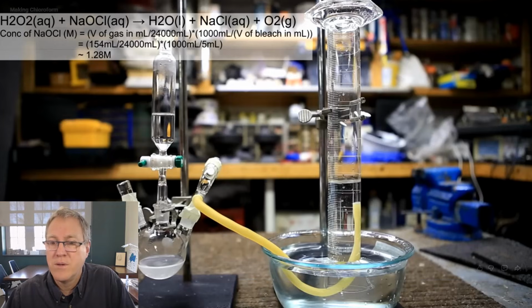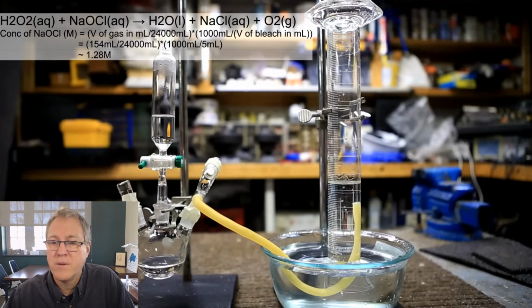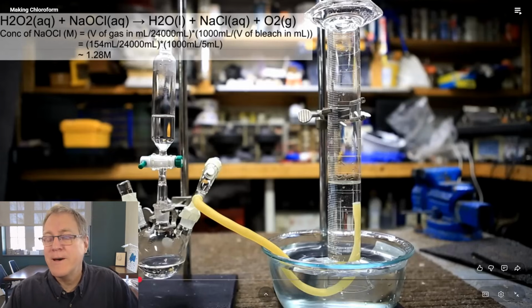The equation that I used is shown above, and the result I obtained was that the sodium hypochlorite concentration was about 1.28 molar. Did you see? He added a few more drops at the end just to make sure adding more hydrogen peroxide did not generate more gas. So he knows that he has exhausted all the sodium hypochlorite in the bleach solution in the bottom of that flask. So he knows he's gone past the end point.